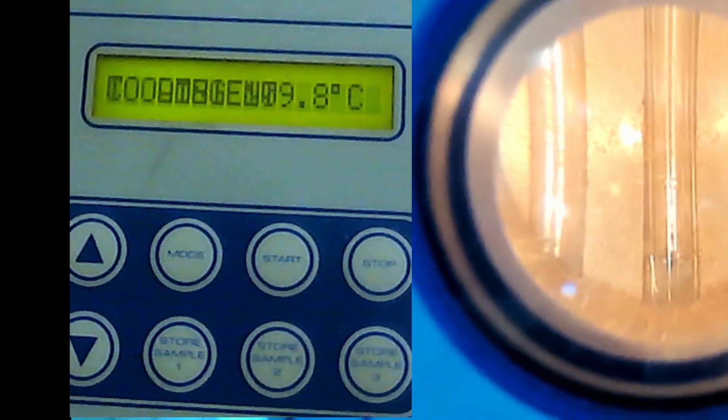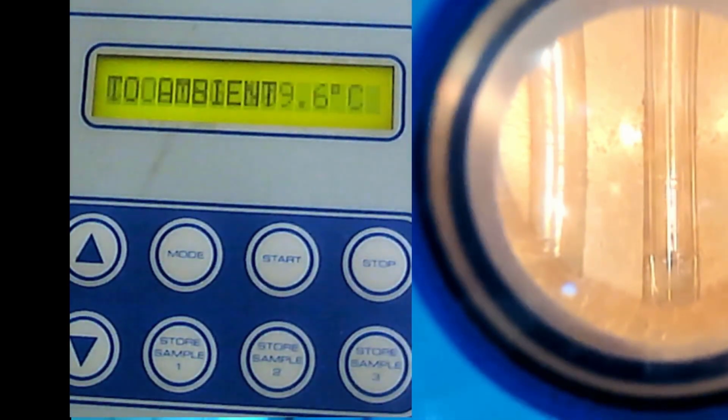During the class, if this is a physical class, each group has their own melting apparatus, and you need to wait until it cools down enough, for example maybe 50 Celsius.